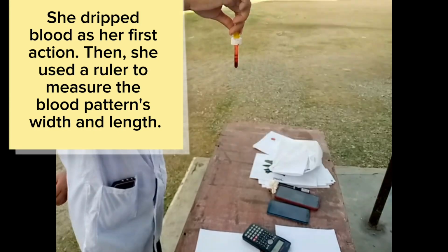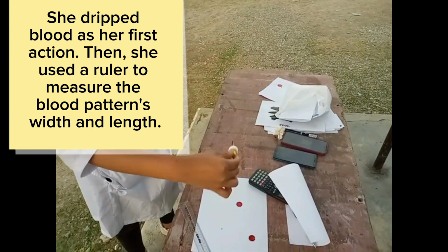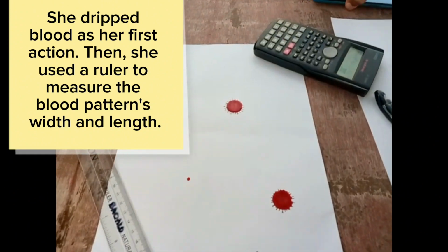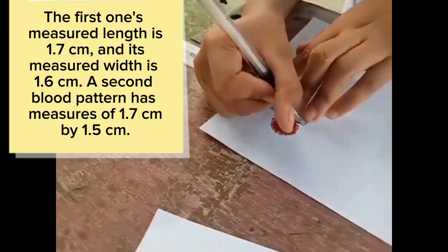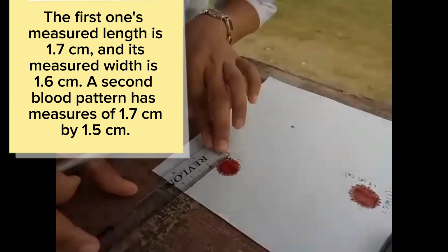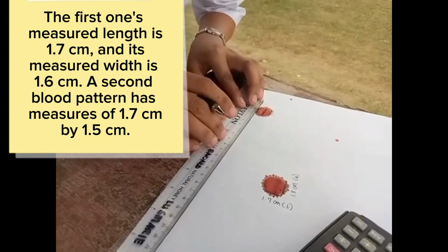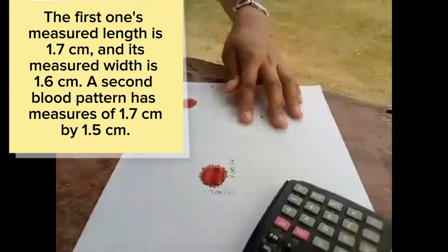Part 4. Angle of impact. She dripped blood as her first action. Then she used a ruler to measure the blood pattern's width and length. The first one's measured length is 1.7 cm and its measured width is 1.6 cm. The second blood pattern measures 1.7 cm by 1.5 cm.